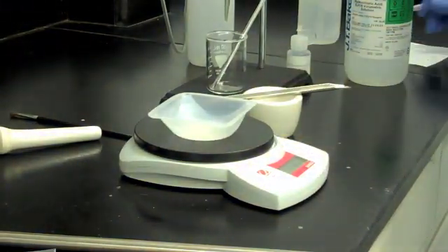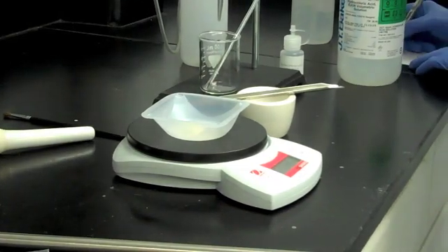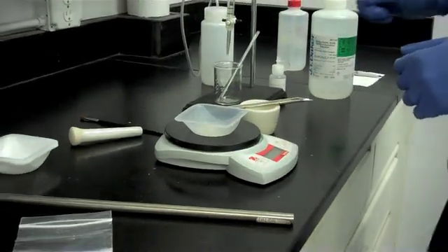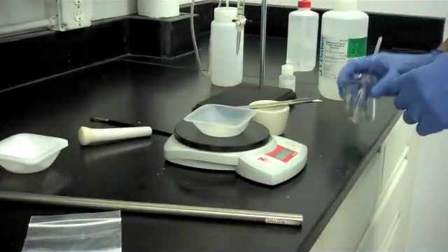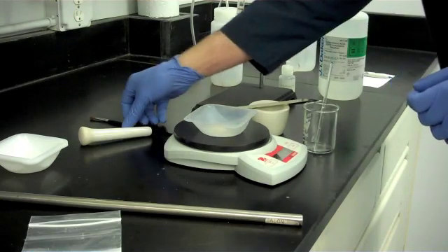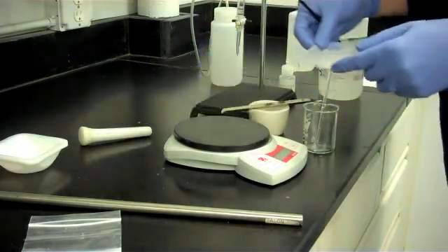Write down the amount of salt to a tenth of a gram. Next, transfer the salt into the 100 ml beaker.